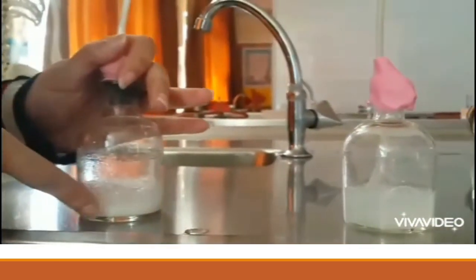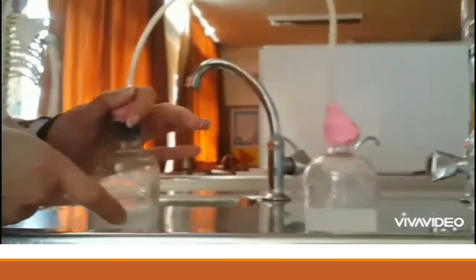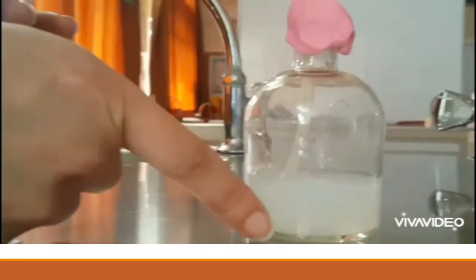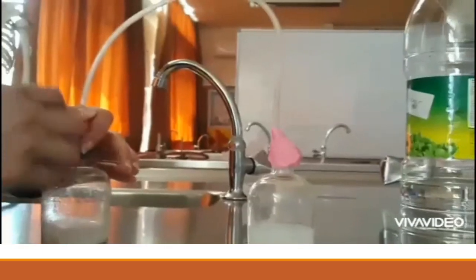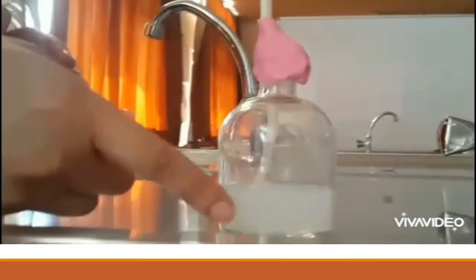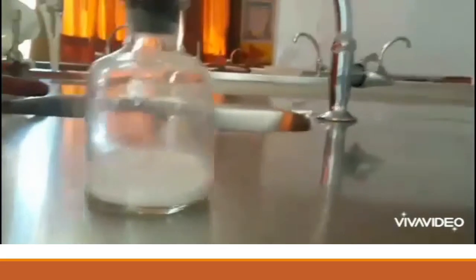Over here, we're going to see that the baking soda turned into 2 layers. One is a precipitate, the salt that is formed as a product, and the water as an upper layer. Then the gas went through the straw to the lime water, and the lime water turned milky. As we can see over here, all the gas that was formed went through the straw to the lime water. The lime water was colorless and it turned milky. That means that the gas we have is carbon dioxide.